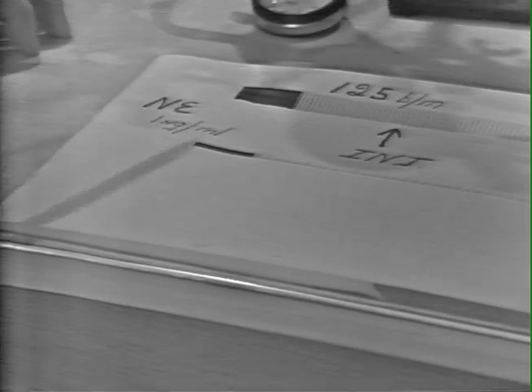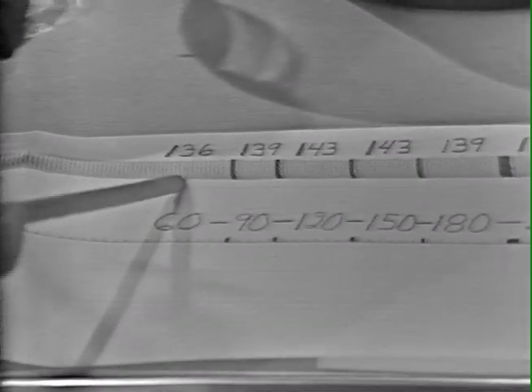We have now obtained the full response to norepinephrine, the concentration of 1 nanogram per milliliter in the bath. The initial contraction rate was 125 beats per minute. Injection at this point, and then after approximately a minute, the rate was 136. Now, at readings after every 30 seconds, we reached a maximum of 143 at about 2 minutes.